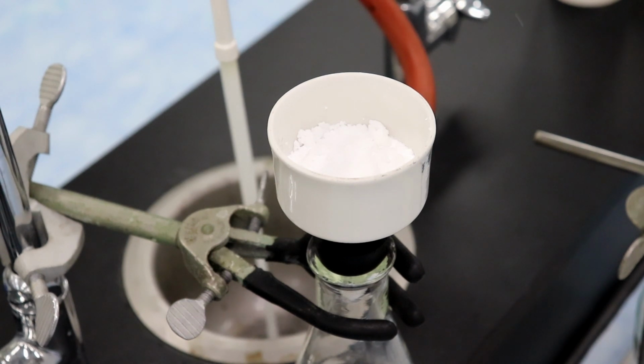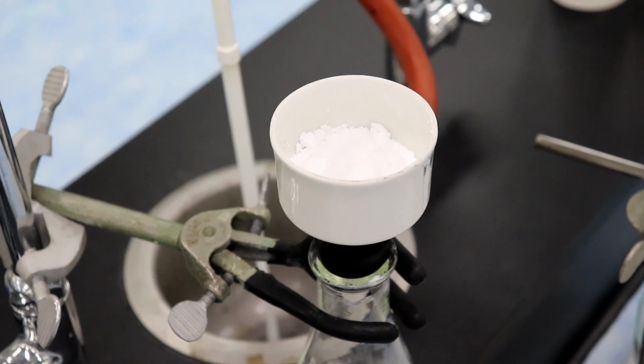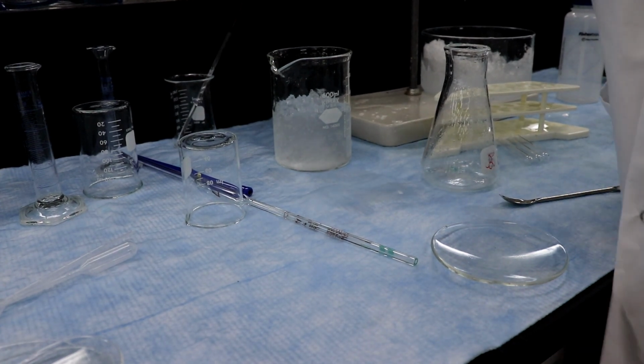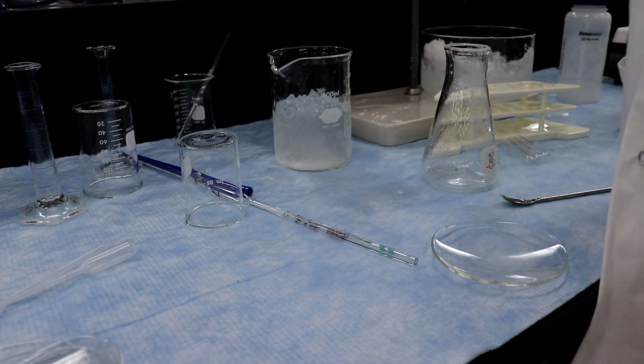So, sorry. No problem. I prepared you a spatula. Perfect. For scraping onto the watch glass that has been pre-weighed. So I assume you're going to use the biggest one this time? Yep. Okay, so we'll move this back down now. Okay, so just going to turn off the water.